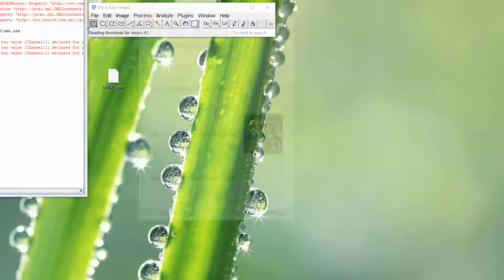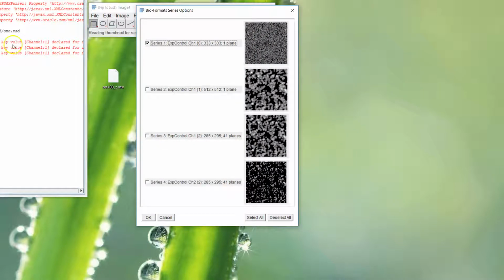If you're okay, you should come up with some errors. The error window will pop up. Ignore those. Some warnings, some warnings, some errors. And then this will show the images from that workspace that was saved. This is the overview image in the first one typically, and then there's the other ones in the little regions of interest that they collected.